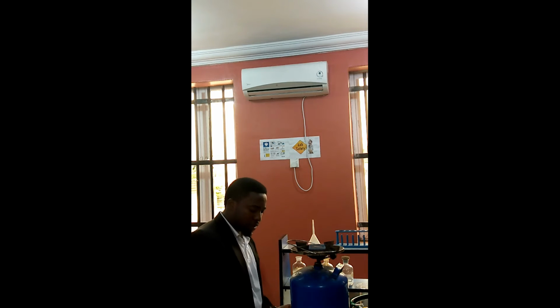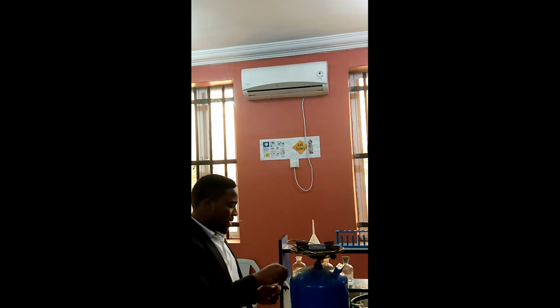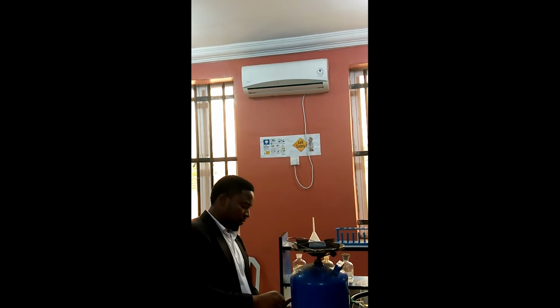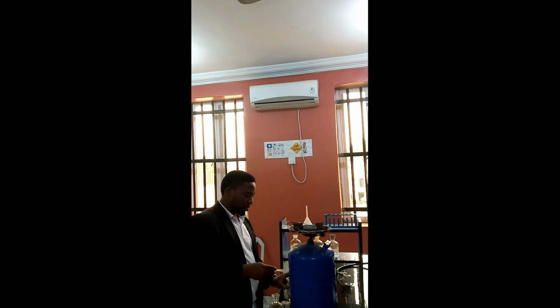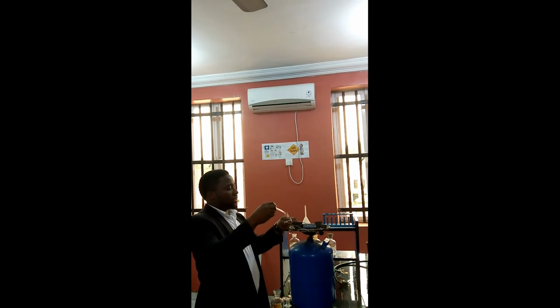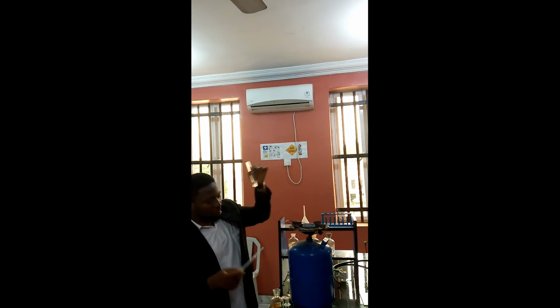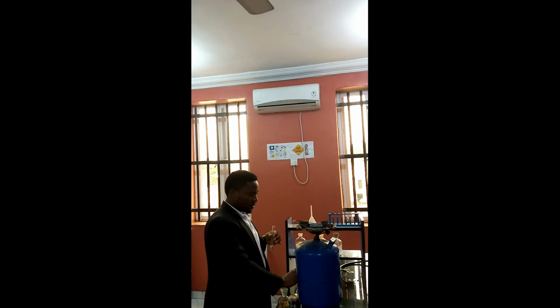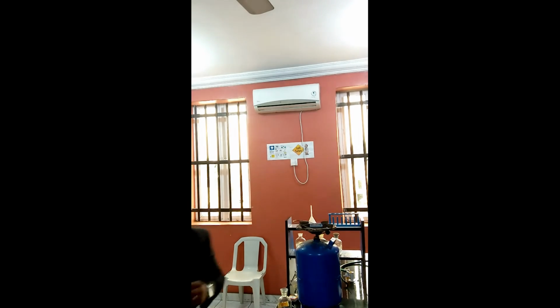Okay, now be a little bit patient. Okay, so I'm going to add my sodium hydroxide solution. I've added my sodium hydroxide solution, followed by heat.